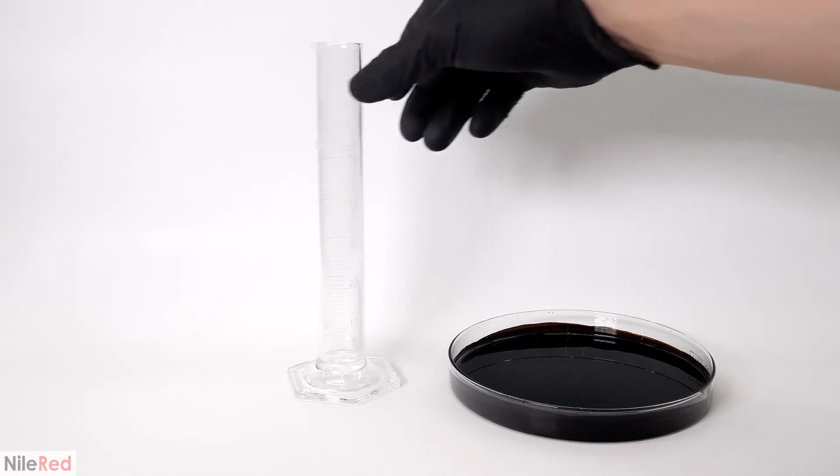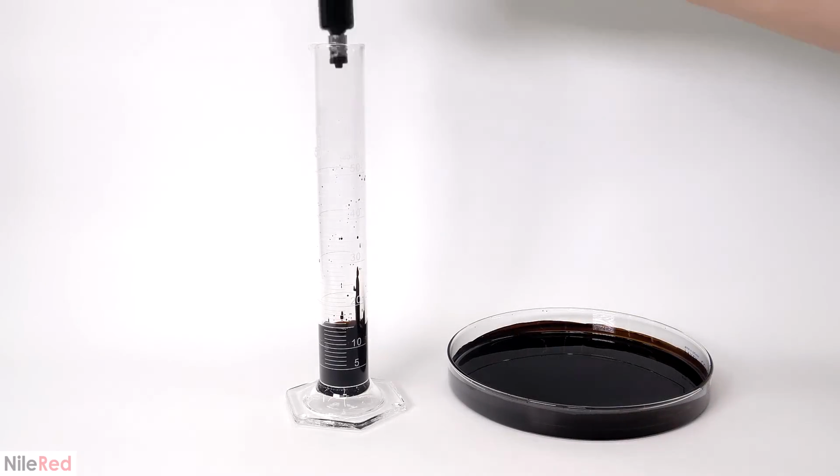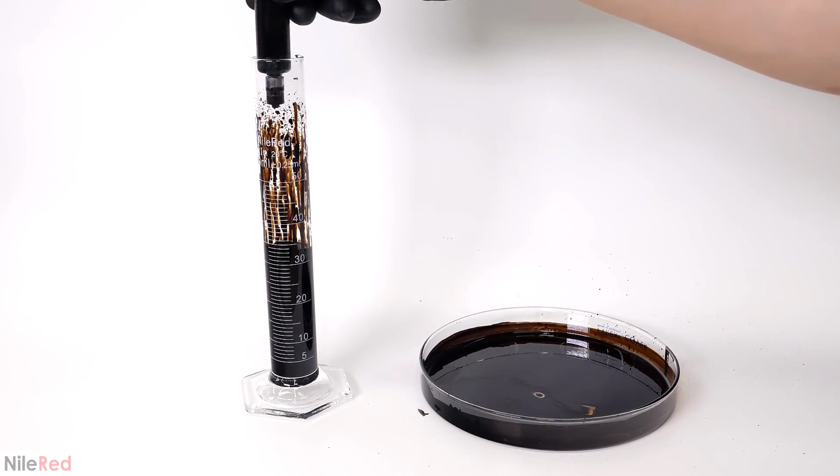To measure the yield, I transferred it all to a grad cylinder, and it came out to be just above 30 mils. There was a small loss from all the stuff that stayed stuck to the dish, but in general, this was pretty much what I usually got.